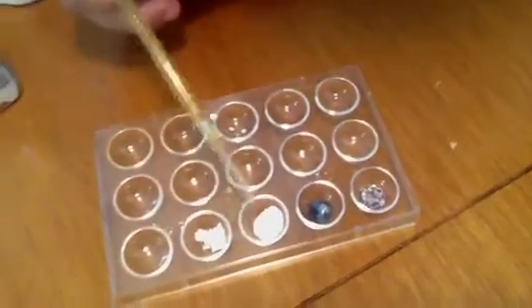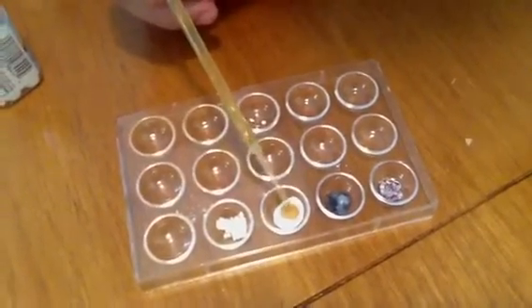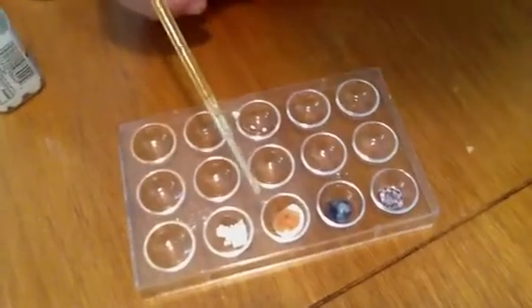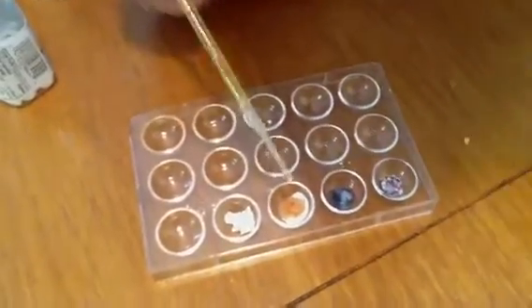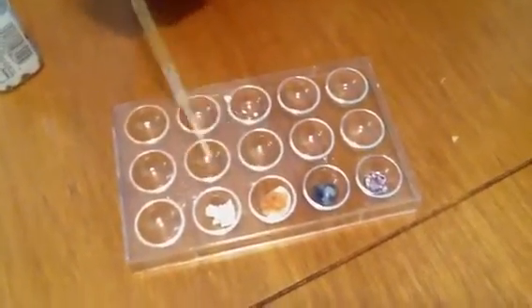Okay, so then we're going to put in the baking soda. It bubbles a little bit, so it's reactive in that way. And we see it turn orange. So that's different than each of these. Each of these reactions so far has been different.